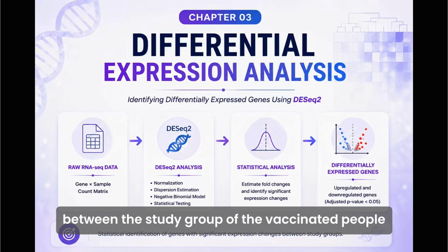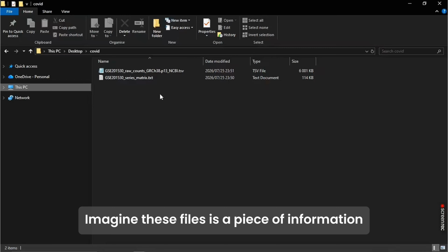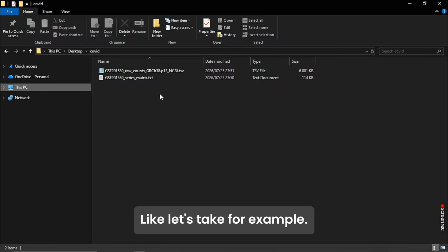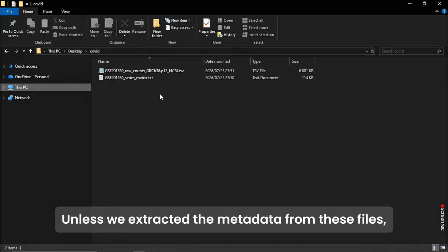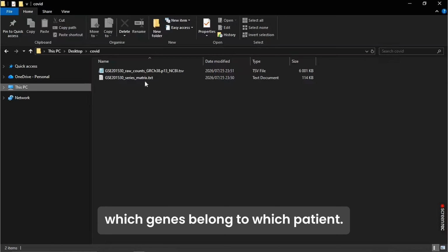Now that we have the 2 files, the series matrix file and the count matrix file, we are first going to extract all the information from the files. Imagine these files as pieces of information with no meaningful interpretation. Take, for example, a hospital that has received a batch of blood samples. You cannot tell which blood came from which individual unless you're given a document that tells you this ID belongs to this person. It's the same with the count matrix file and the series matrix file. Unless we extract the metadata from these files, we are never going to know which genes belong to which person.